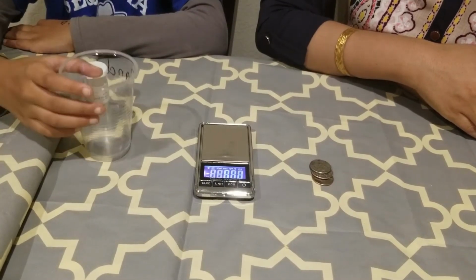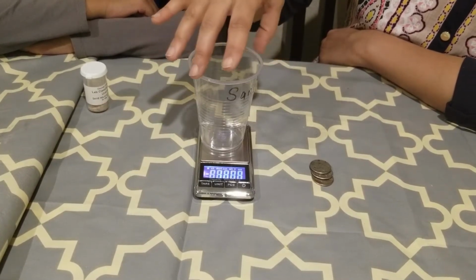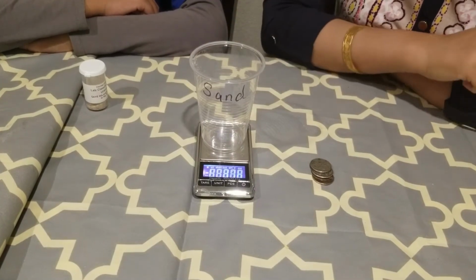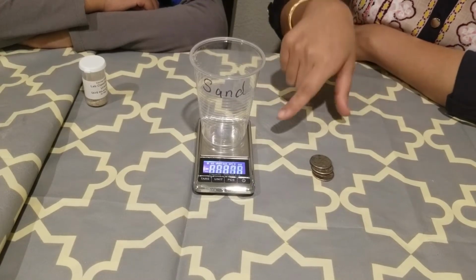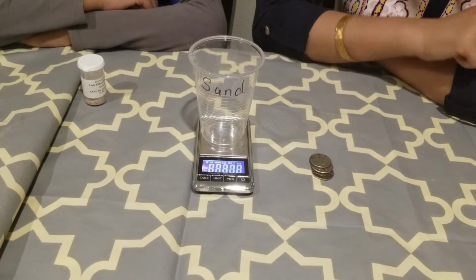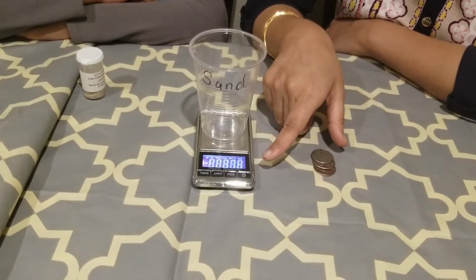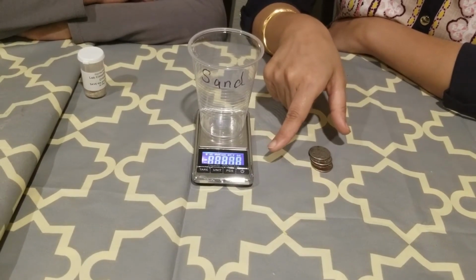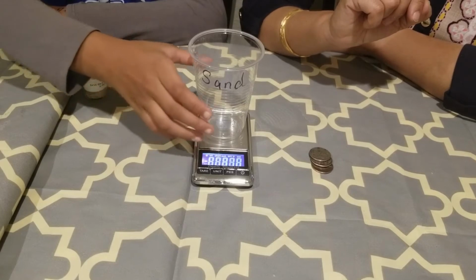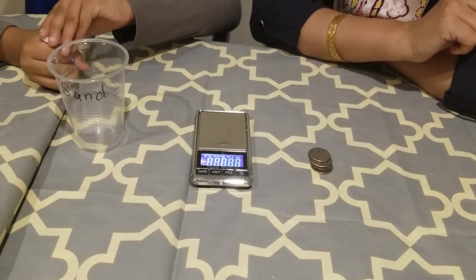So Ima, can you please put this empty container here? And since we are doing this for our lab, which is called salt and sand lab, separation of salt and sand, this beaker where we are going to transfer this needs to be labeled as sand. So I have already labeled it as sand, and the weight of this empty beaker is 3.76 gram. I will record this reading in my report form, and after that we will just move this beaker or this container away from the scale and transfer this sand and salt mixture.